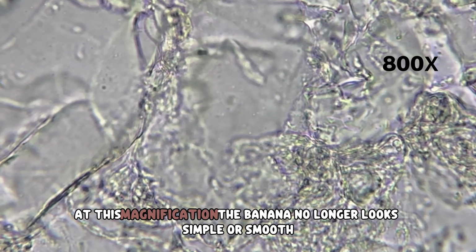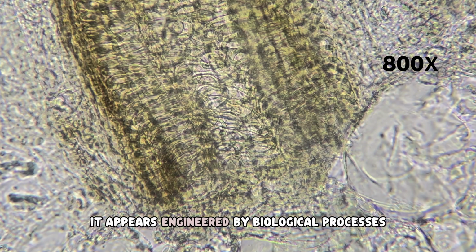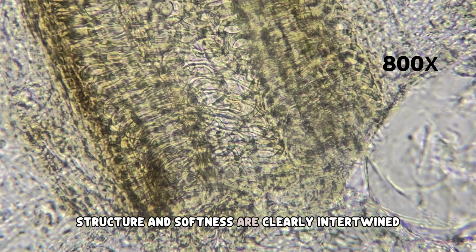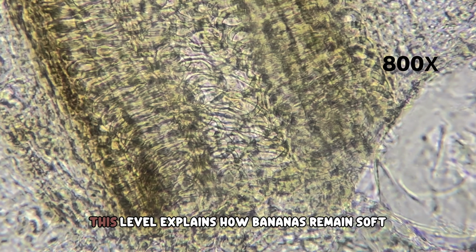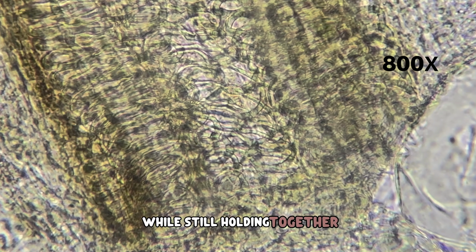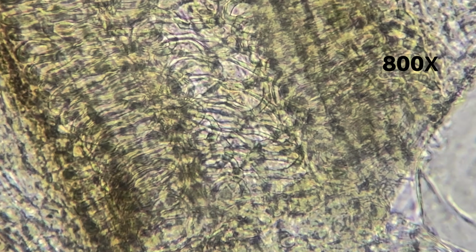At this magnification, the banana no longer looks simple or smooth. It appears engineered by biological processes. Structure and softness are clearly intertwined. This level explains how bananas remain soft while still holding together. The internal framework becomes visible for the first time.